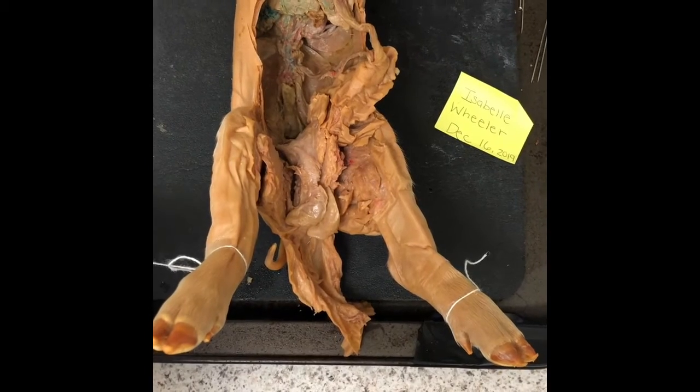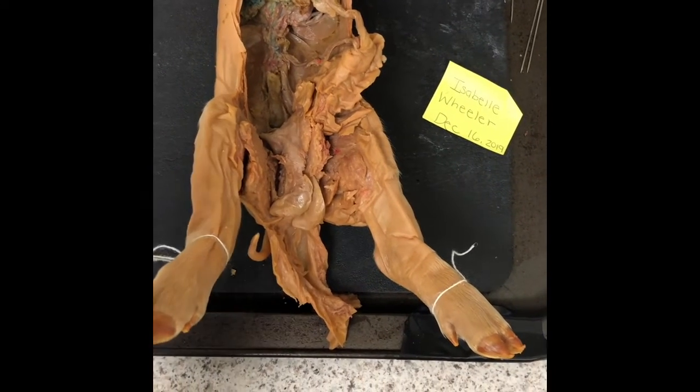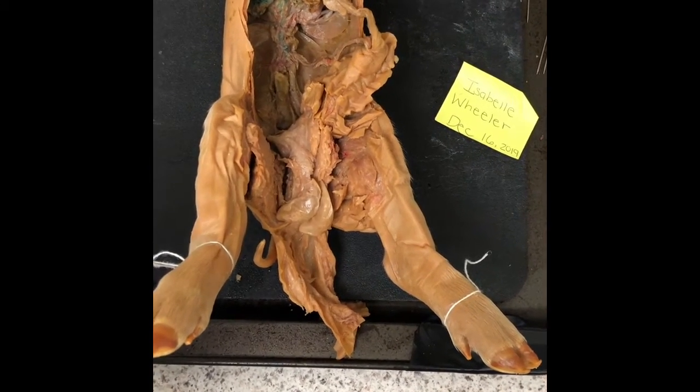It is December 16th of 2019, and this is the week 8 video lab exercise of the reproductive system. In this video, I'll be dissecting the reproductive system of my male fetal pig, and then I'll be identifying the umbilical cord, the urogenital opening, and then 8 other important reproductive structures on my pig. So I've dissected my fetal pig and the male reproductive system of my pig.